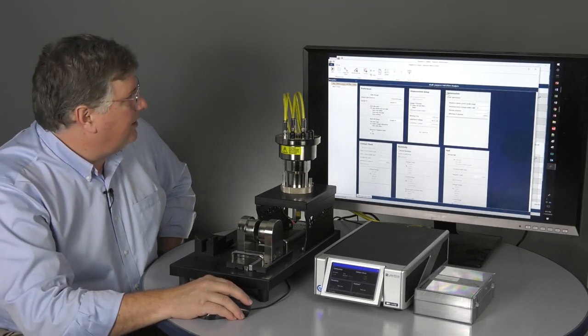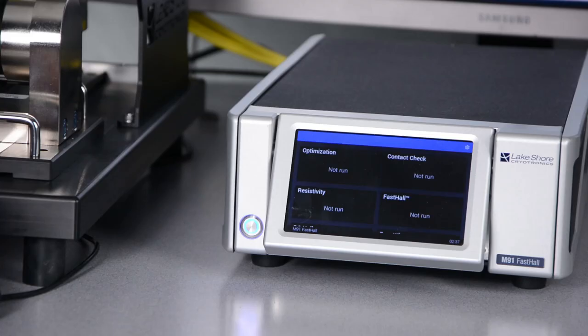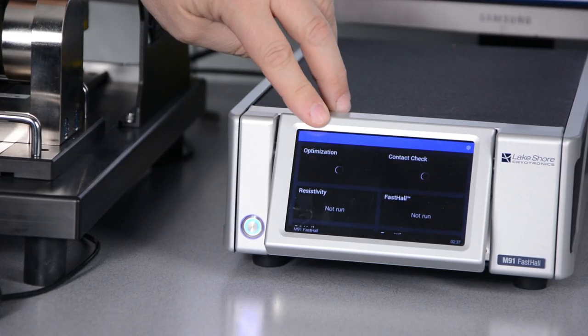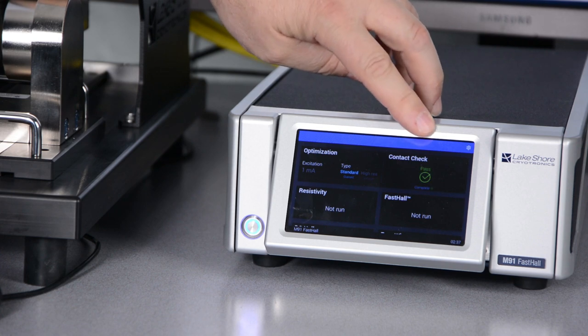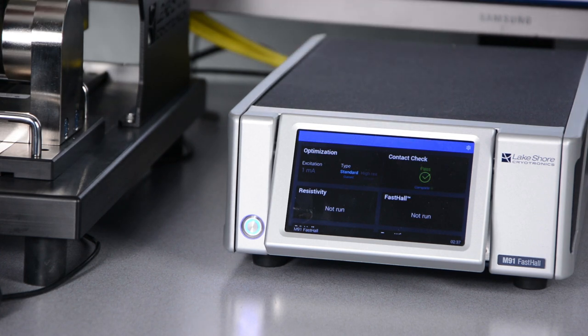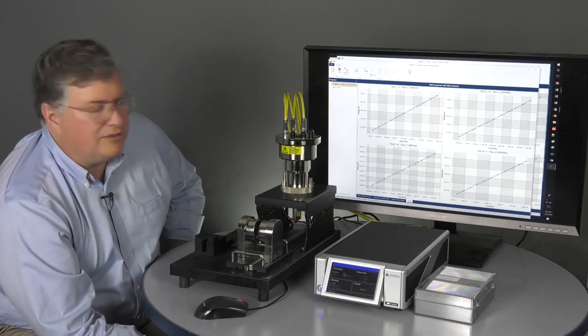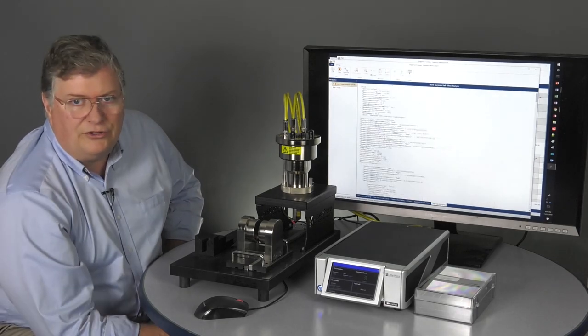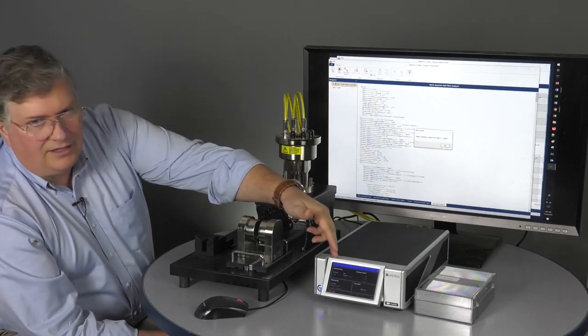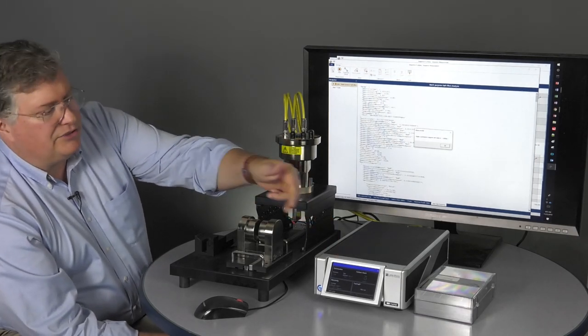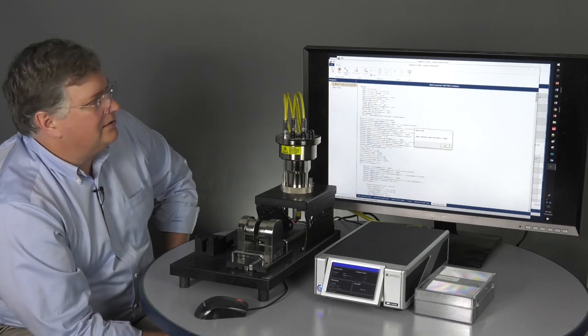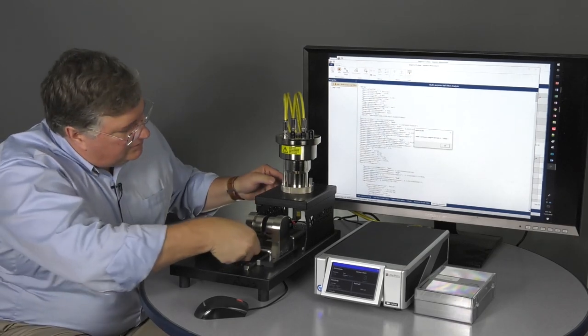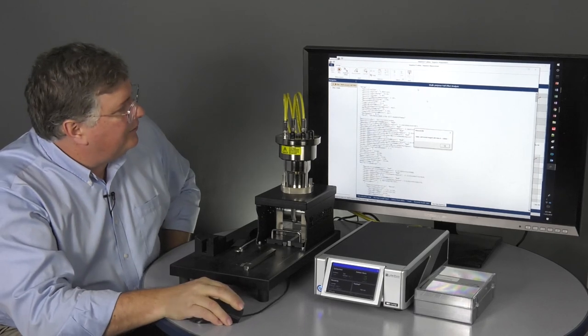So I'll go ahead again and run the fully optimized measurements. It's going to rerun the optimization because I've asked it to. This is a very convenient feature if you're doing a temperature swept measurement where your resistivity is changing over a large value. While you're changing temperatures, it will go ahead and reanalyze each temperature and allow you to keep a very optimized excitation value.